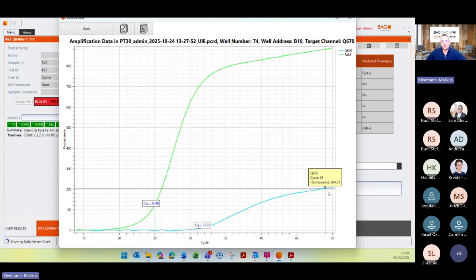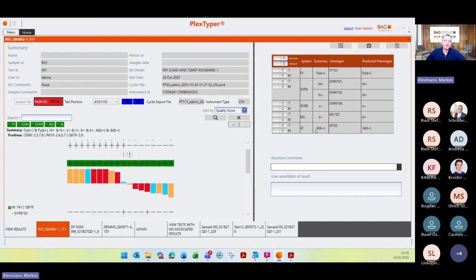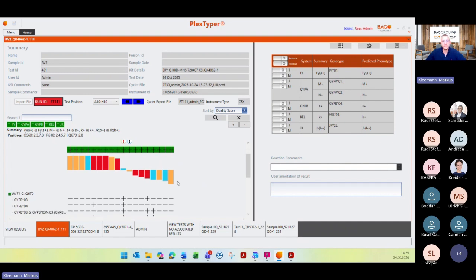I mean, okay, the curve looks not really nice, and there is also just a slight increase of your target. So this can be because of different things: because the extraction is not optimal, the DNA concentration was too low, or the quality of this sample was not that good. It can be that the fluorescence was too low, for example, pipetting issues, or that because of the test design, different probes are a little bit lower compared to others. And then when you have a little bit less quality of your DNA, then it can look like this one here. So please check these reactions. Probably if you have no results here in this summary, then you have to repeat this, check again the concentration and the quality of this reaction.